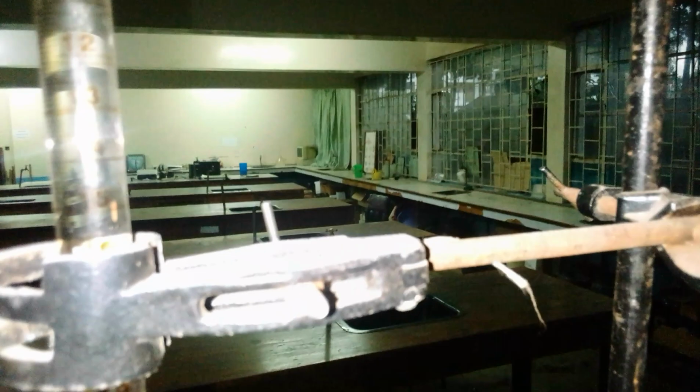So now, our initial burette reading when we shall be doing the third titration. Are you deciding just to put it to 0.0? You can just choose whatsoever volume that you might use, but it is not a must that you utilize 0.0. In this case, we have decided our initial burette reading here.